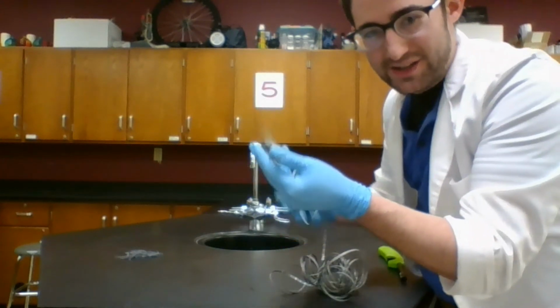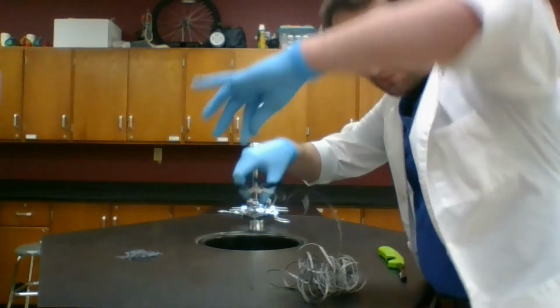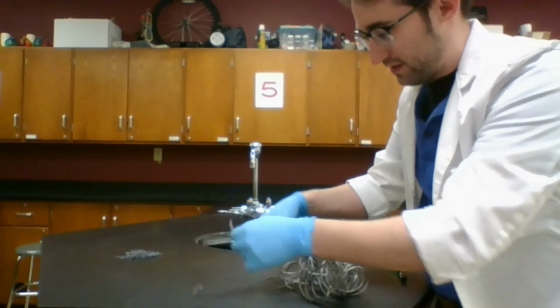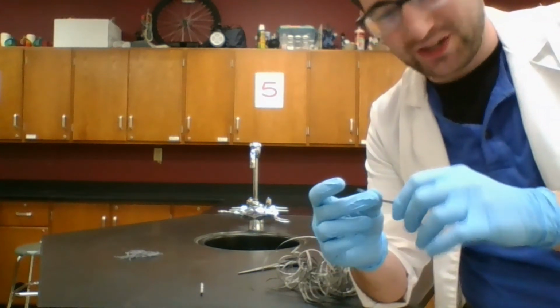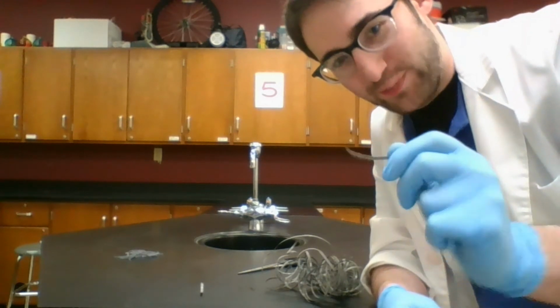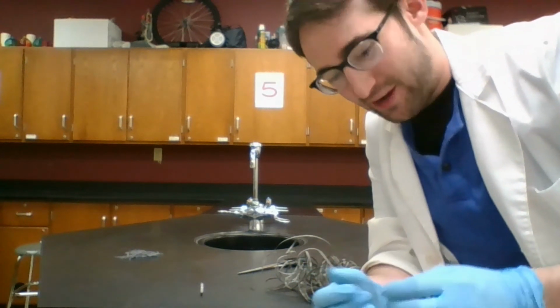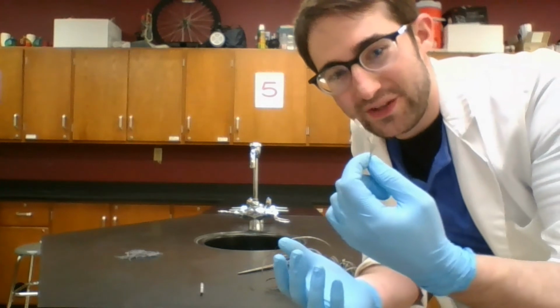All right. So I can just take a regular pair of scissors. I'm just going to snip off a piece right there. Okay. Now when I do this, I'm not changing the magnesium to some new substance. I'm not changing anything about the scissors. I'm just making a smaller piece of this, kind of like breaking off little bits of that graphite. Okay, so anytime you are cutting something, or breaking something, ripping something, tearing something, that is all a sign of a physical change.